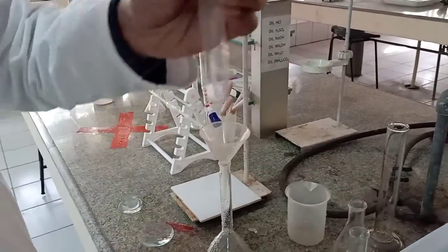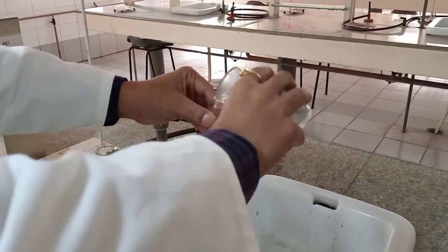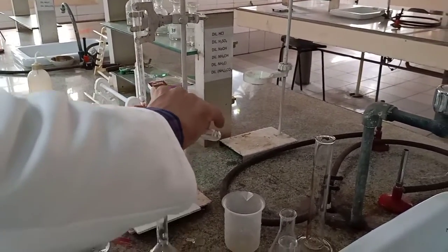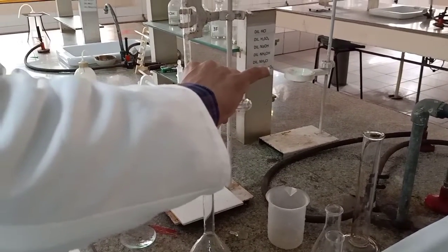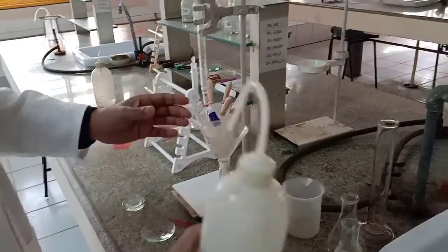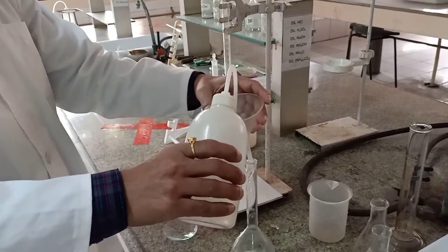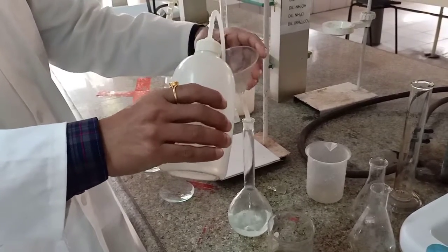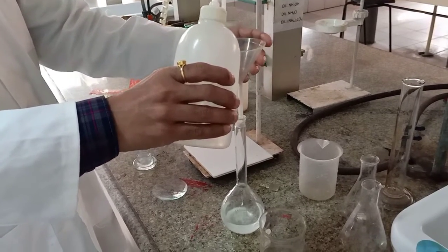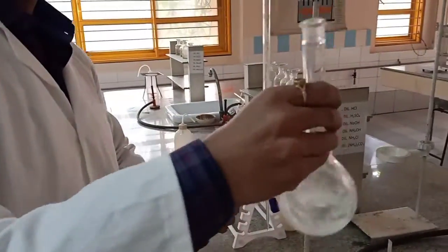You can see it, it's 4N H2SO4. I take one test tube full of 4N H2SO4 and I'll be adding it to the salt like this. Okay, fine. And now I'll be adding distilled water with the help of a wash bottle. So with the help of the wash bottle, I'm adding distilled water. I ensure that no particle is left either on the funnel or on the stem of the standard measuring flask, and then I swirl it.